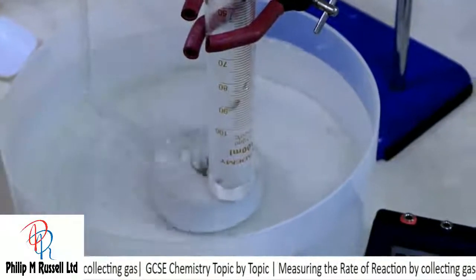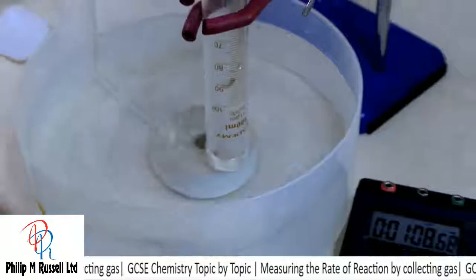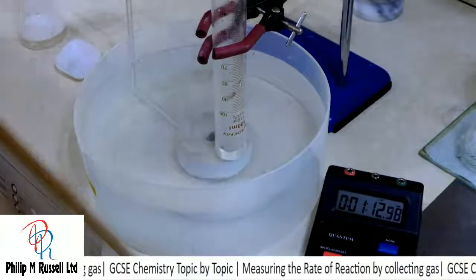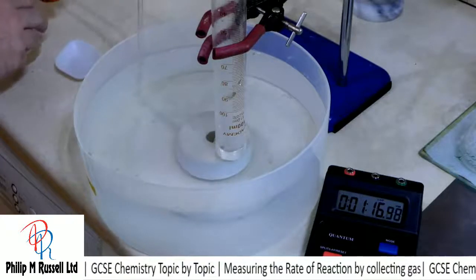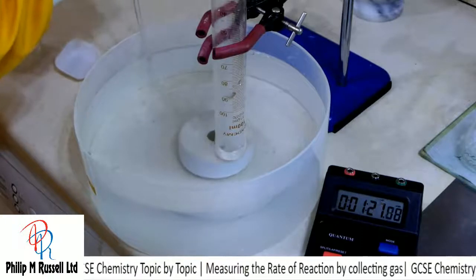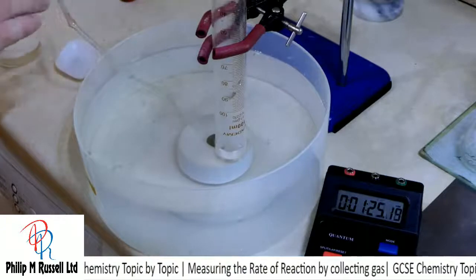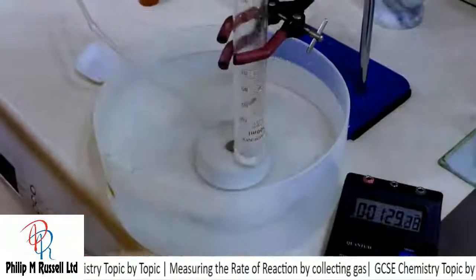This way seems to work quite nicely. It's quite an accurate way of trying to measure what we've got. We should get the same results with this, and that's why I didn't bother to basically record everything, because I've done the experiment already, and this is just trying to show you an alternative way of making it work.